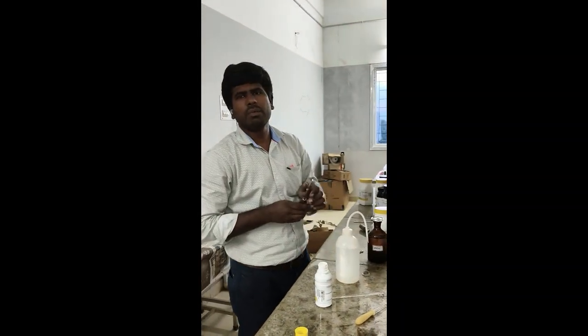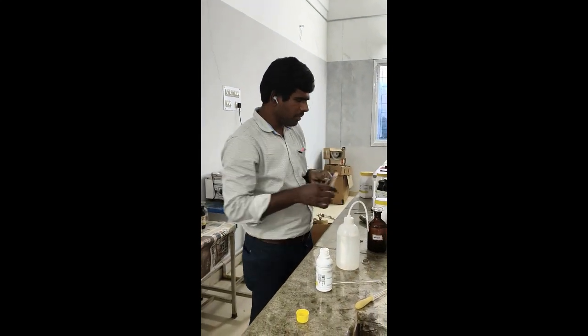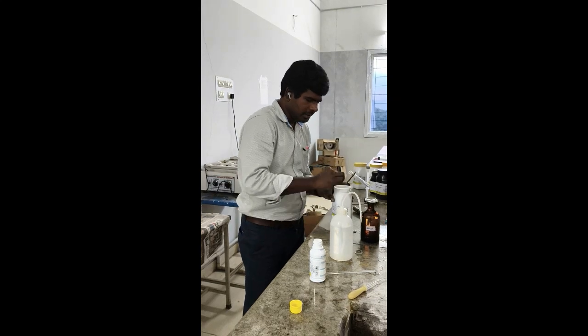Okay, next we have to confirm sulfate also. So for this, take a new test tube. Again add the salt.